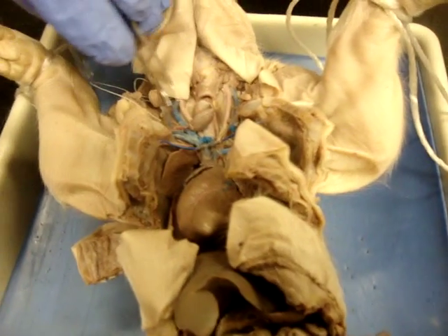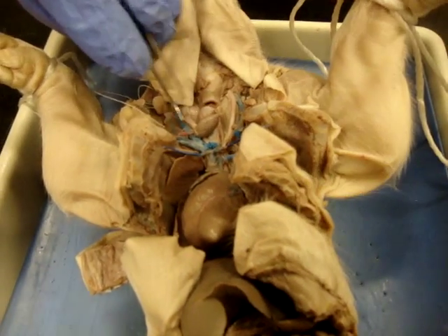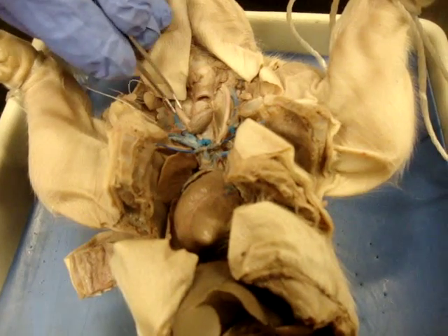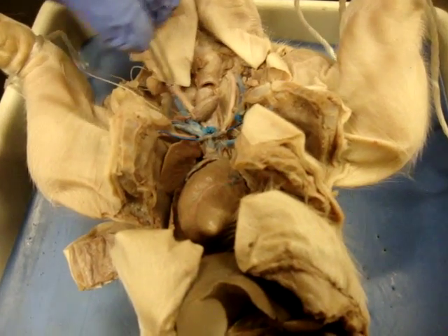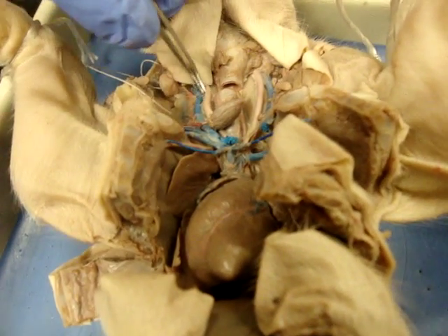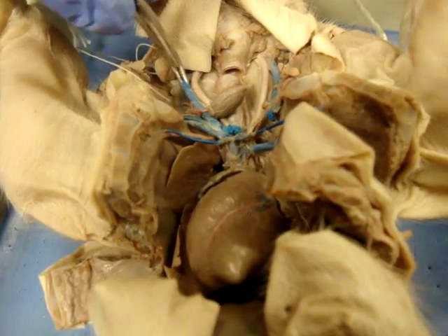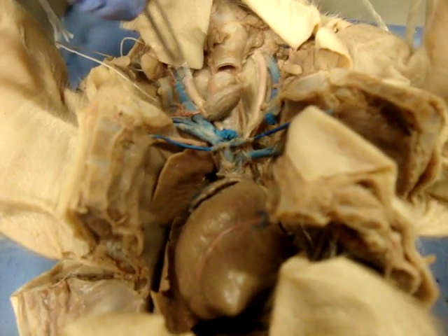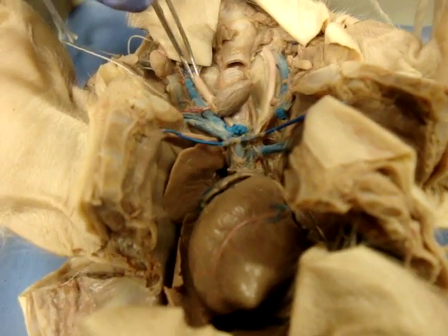We're going to do your jugular vein and your carotid artery. If you know that those two things are in the neck region and that they're paired together, you'll be able to find them. So jugular vein, carotid artery.